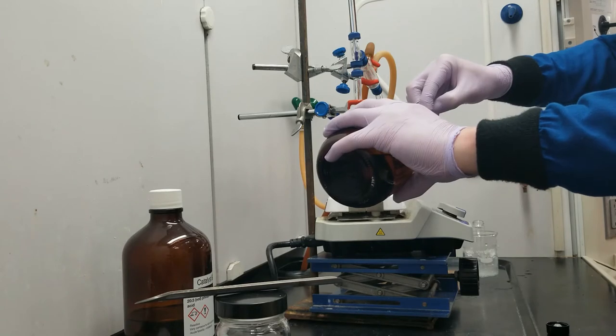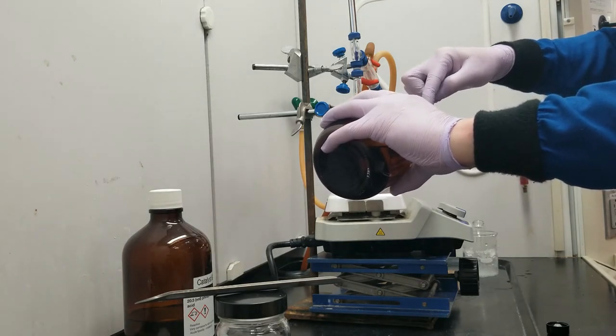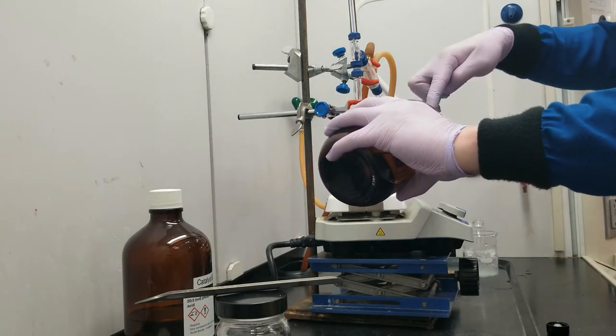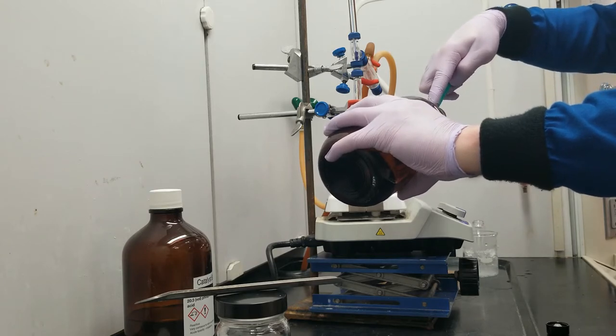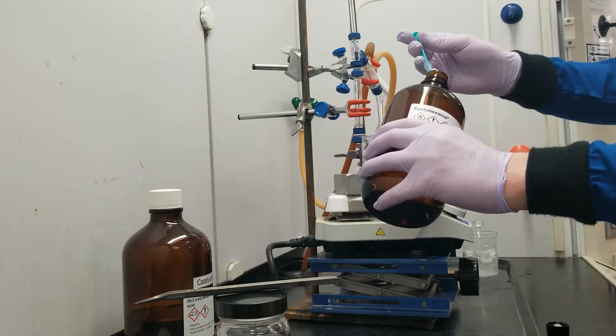So I'm going to go ahead and measure my cyclohexanol with a syringe, just because it's hard to get a nice 2 milliliters measured with a graduated cylinder.